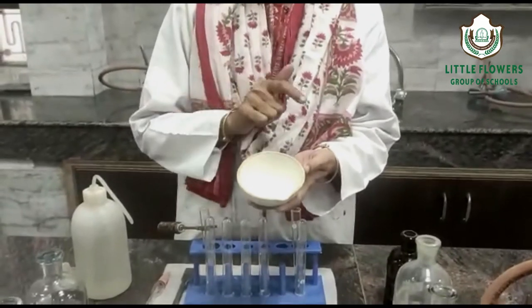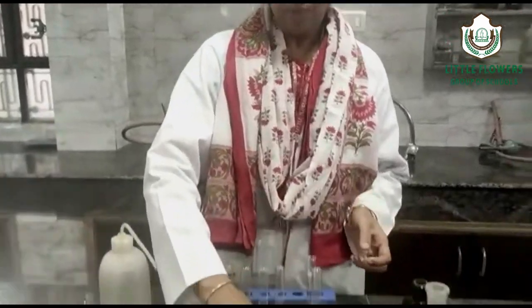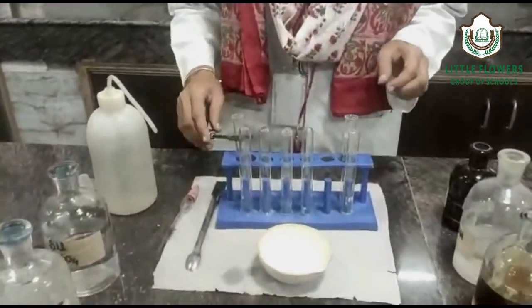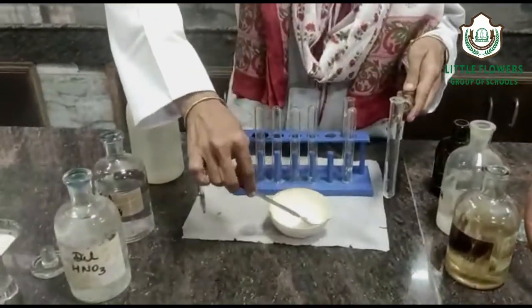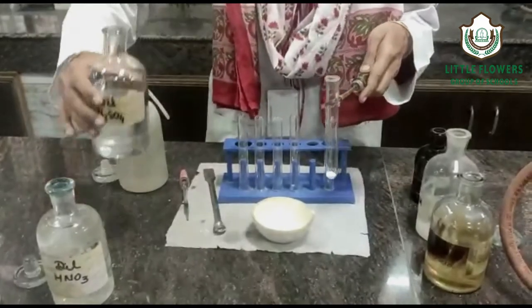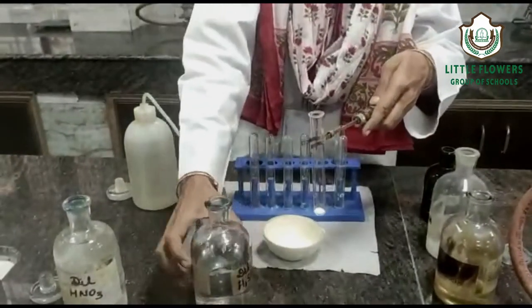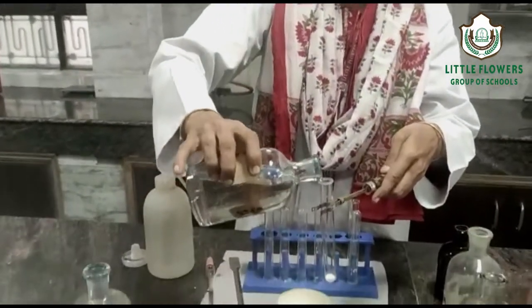We will check when we make the aqueous solution of the salt. Now we start the experiment. We take a test tube and put the salt in it, then add dilute H₂SO₄.